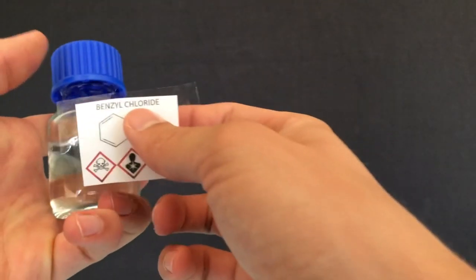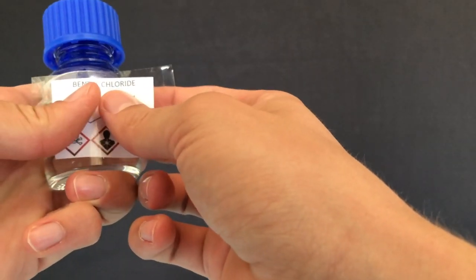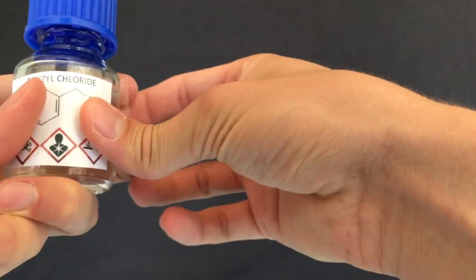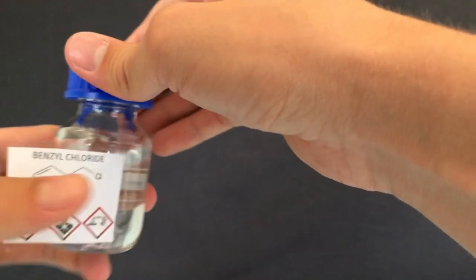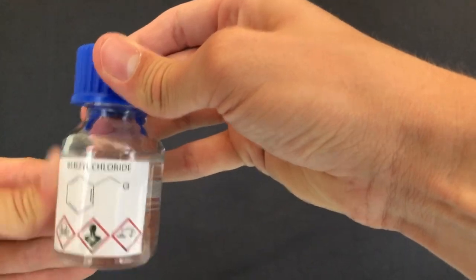Benzyl chloride might look harmless, but it is a potent lacrimator and it is toxic. I am not saying this because I read it somewhere online, but because I actually felt its lacrimatory effects. They are not as bad as I expected them to be, but they are still noticeable.